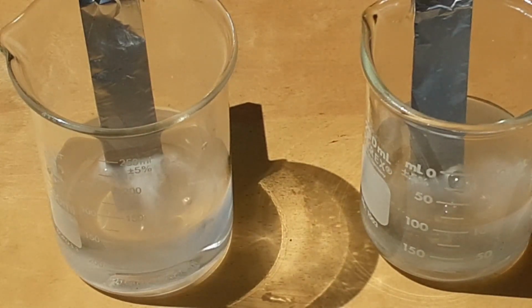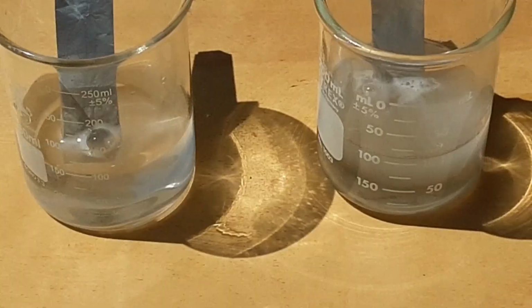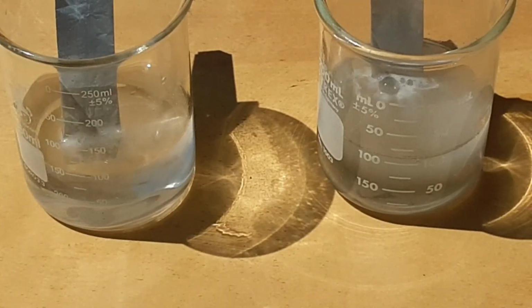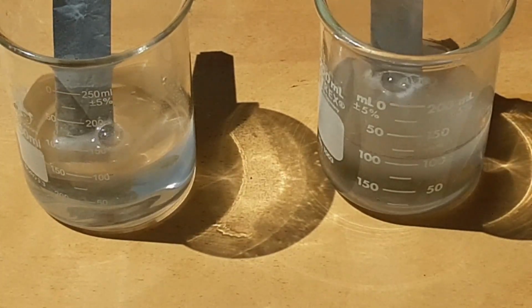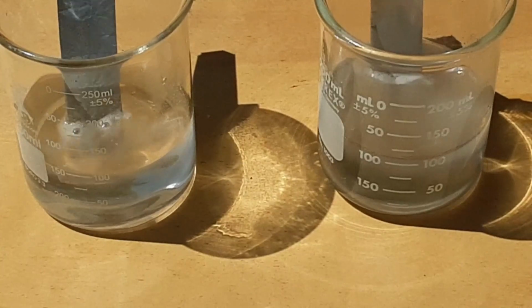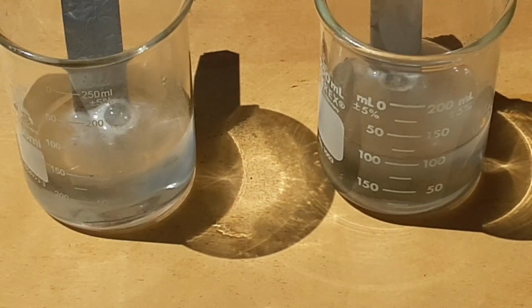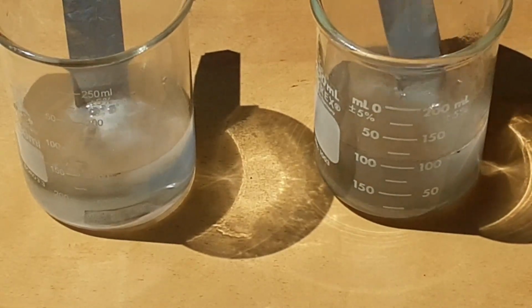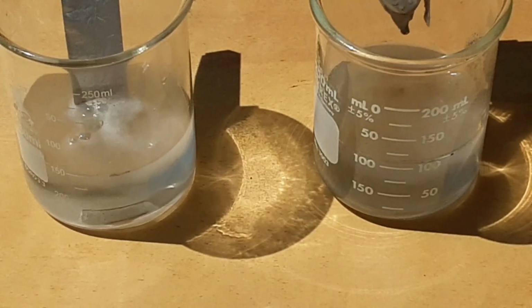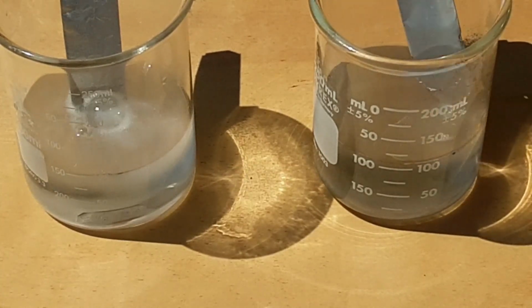So I'm just not quite sure what to make of that. I'm not getting any closer to that than I have to at this point, because you can't really see where those fumes are heading towards. But there's absolutely nothing left of that one, really.